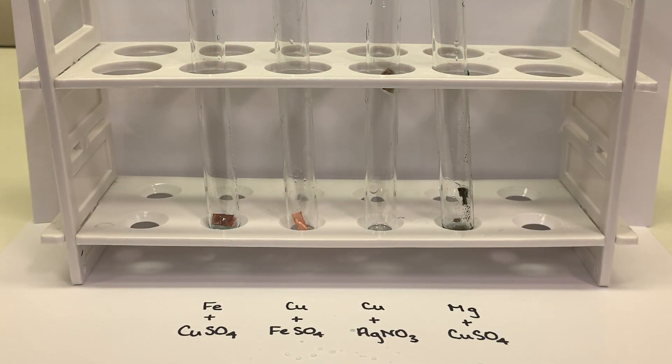Alright, that's it. This was four attempts at single replacement reactions. Based on your observations, you should be able to tell which reactions went forward and which ones did not.